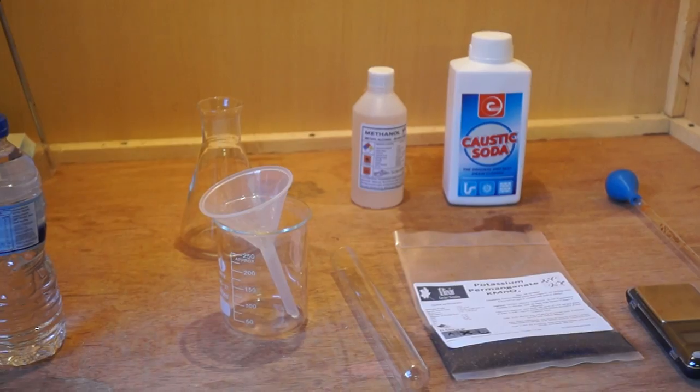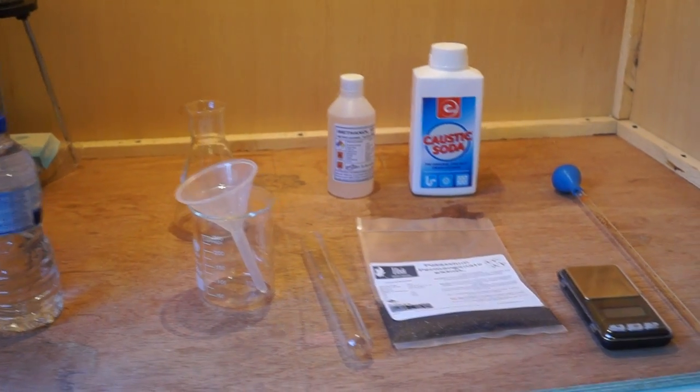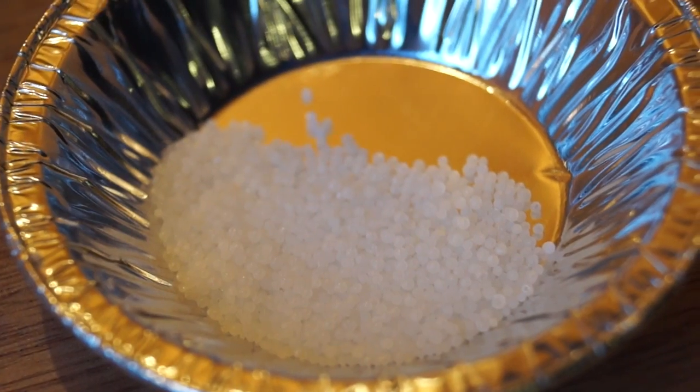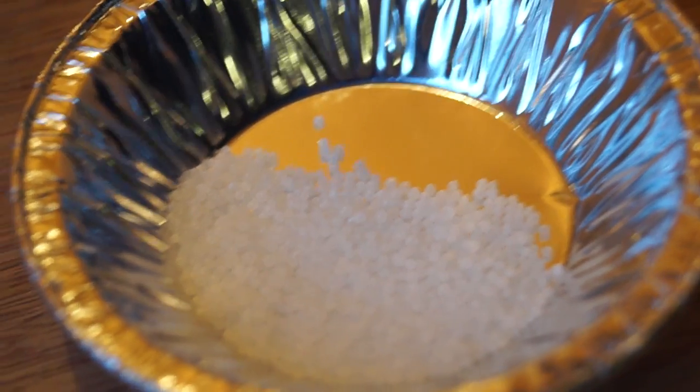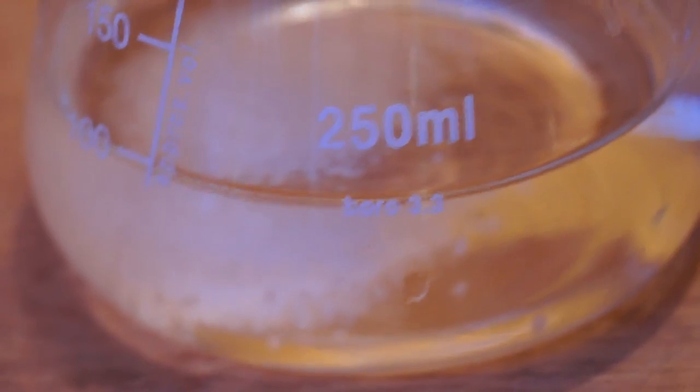In the reaction, sodium hydroxide is used as a catalyst for greater oxidation speed. First, I prepared my sodium hydroxide solution by dissolving approximately 5 grams of sodium hydroxide in 100ml of distilled water, then added about 6ml of this to a test tube.